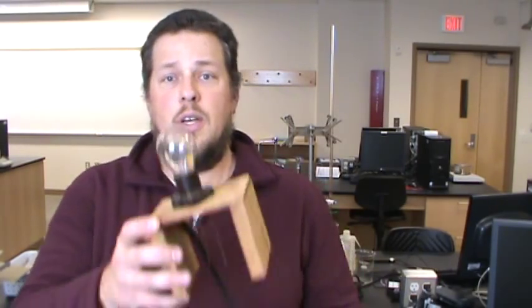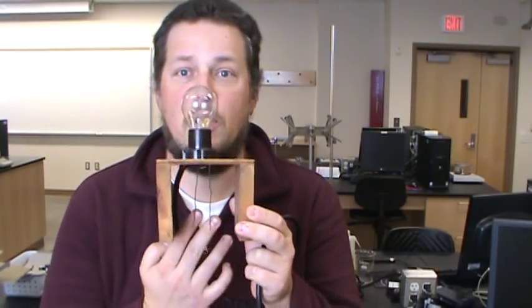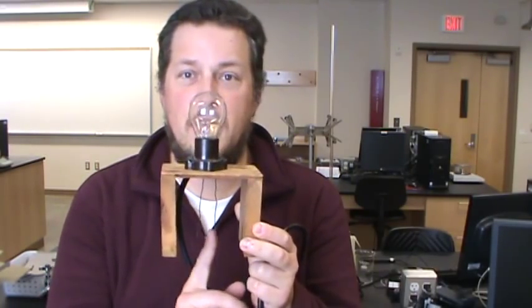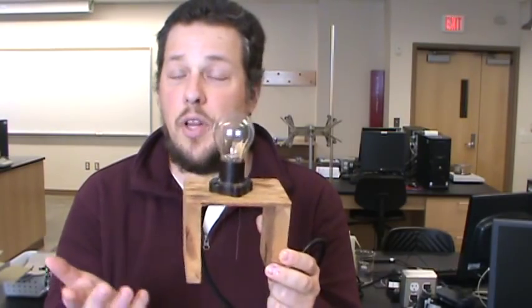We're going to be using probes that give us a lot of information, but when we're measuring conductivity, we don't need anything all that high tech. We can pretty effectively measure the conductivity of a solution with something very simple — a light bulb wired up with two bare wires sticking down. If there's something between those wires that can conduct electricity when it's plugged in, the light bulb will turn on; if not, it won't.